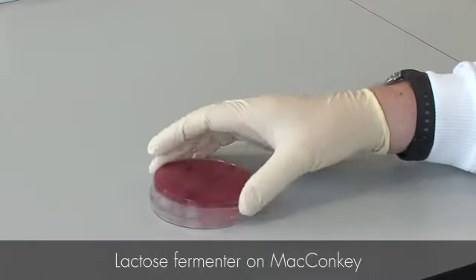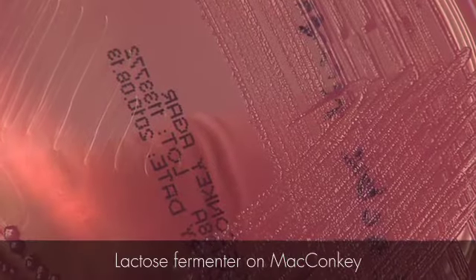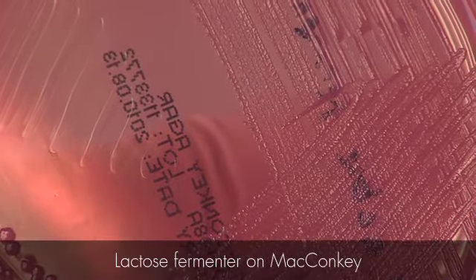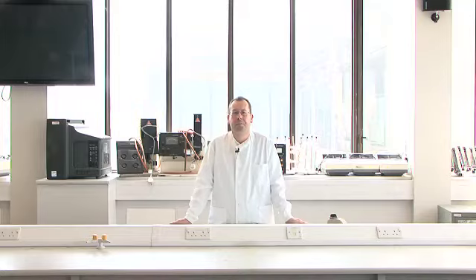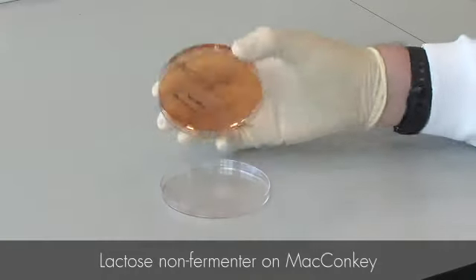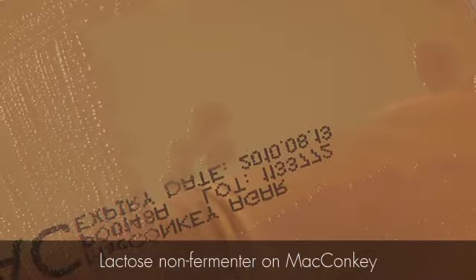So if lactose is fermented by a bacterium, the pH drops to acidic and the dye turns from colourless to pink, producing pink colonies. If the lactose is not fermented, the colonies are colourless. So in this case, a lactose-fermenting species such as E. coli produces pink colonies, whereas a non-lactose-fermenting species such as Salmonella produces colourless colonies.